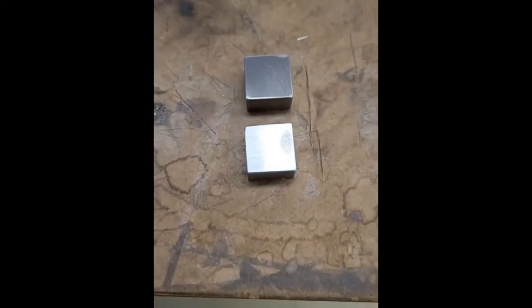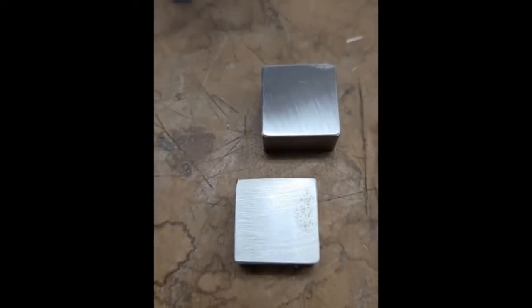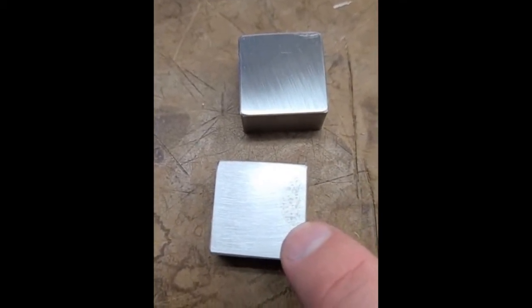So these are two samples. They're at an intermediate polishing step, so you can still see those scratches. What I did though is I just left a little drop of water on the one that's closer to me, okay? Now, what you'll see is if I wipe this off, that it's still discolored in that spot, okay? That's just the formation of iron oxide or rust on the surface.